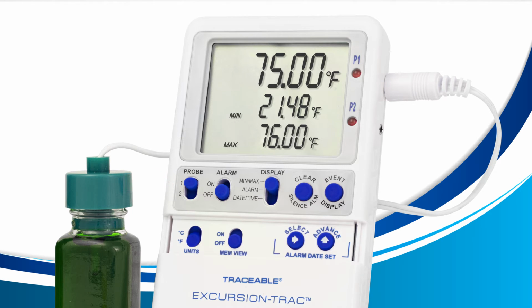Next, look for the display switch on the center of your device. Move it so that it aligns with the word alarm. This will change your display to show your current temperature at the top, your set low alarm in the middle, and your set high alarm at the bottom. Keep in mind, this is what my device says. Your device may show different numbers. Now, with our device ready, let's view our alarm event history.